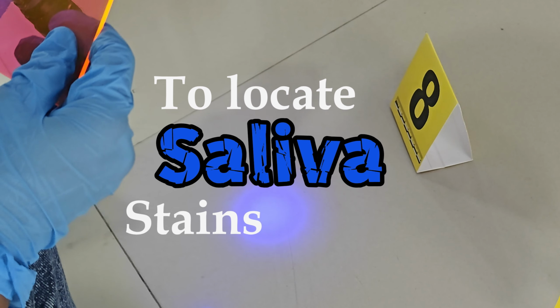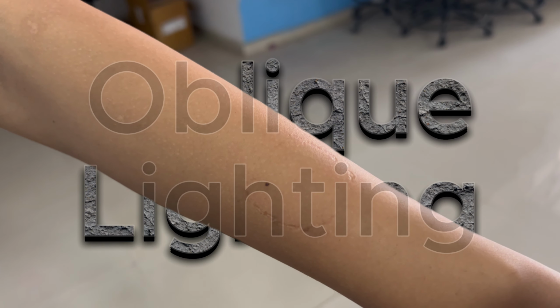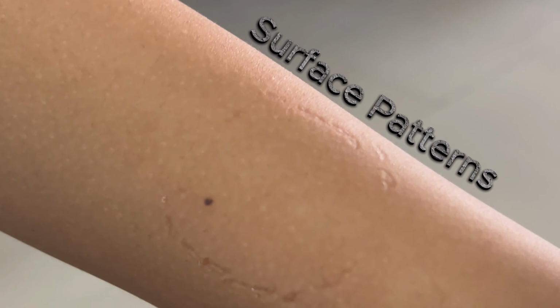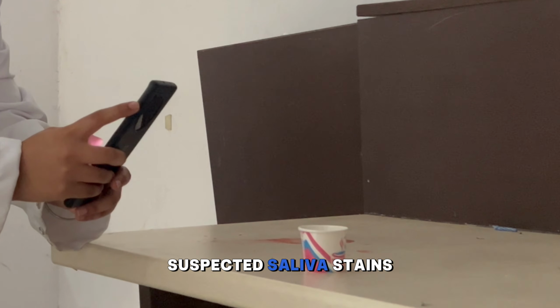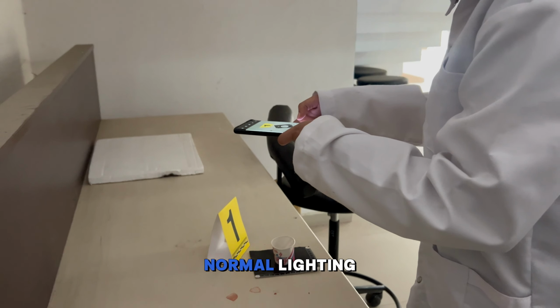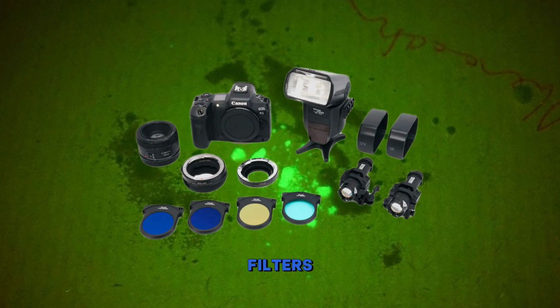To locate saliva stains, investigators use different techniques, which are oblique lighting, which reveals surface patterns, UV or alternative light sources to show fluorescence, and lastly, chemical reagents as a confirmatory test. Suspected saliva stains are photographed under normal lighting as well as alternative light sources with appropriate filters.